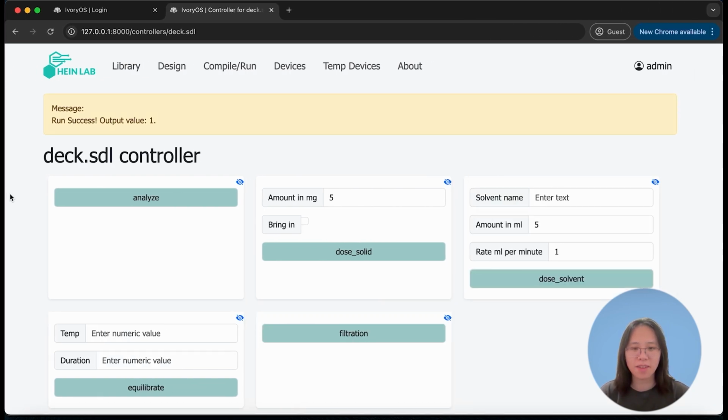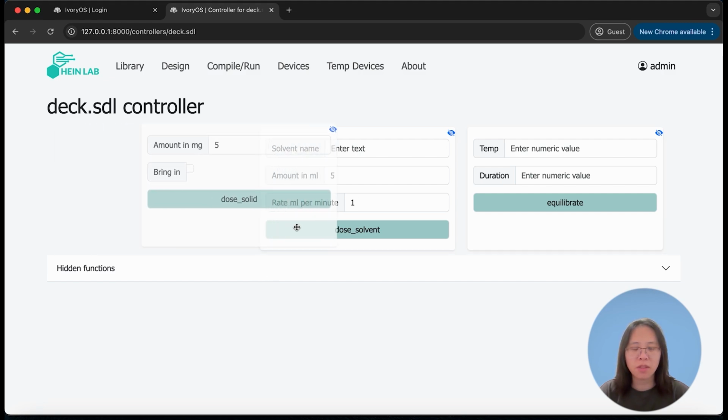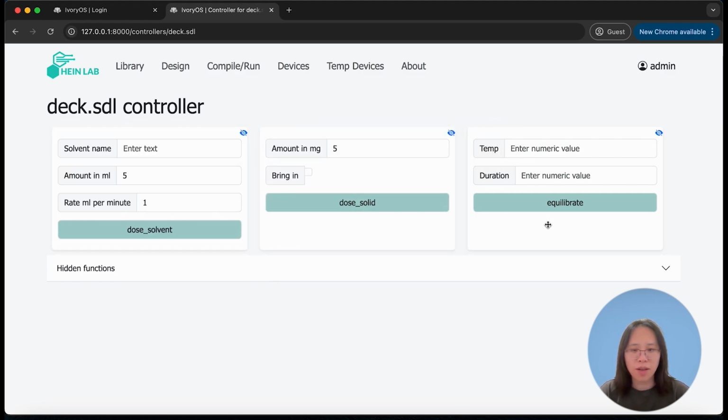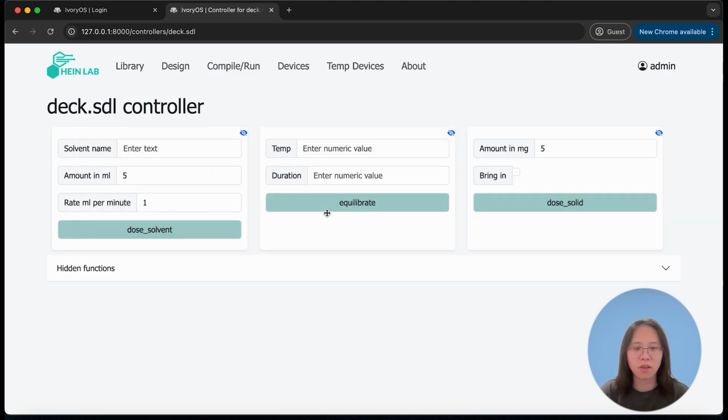So this one is an oversimplified script with only 5 functions, but in the real world, there definitely could be more than 5 functions in one Python class. So if some of the functions are not very frequently used, then you could have the option to hide the function for now from this user interface. At the same time, you can also toggle the card sequence, and in this way, you can customize this interface depending on how frequently you want to call those functions, so it's more effective and user friendly.